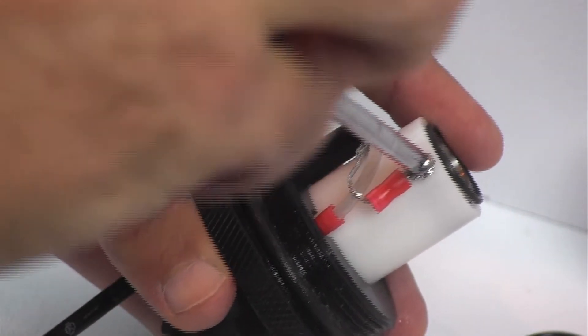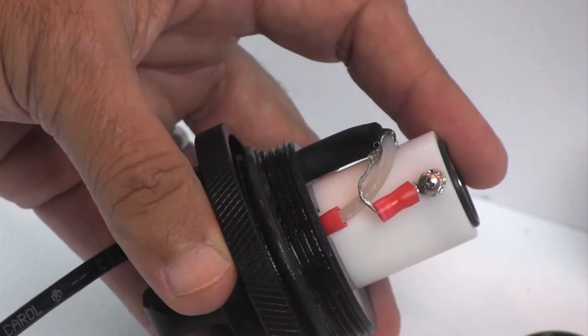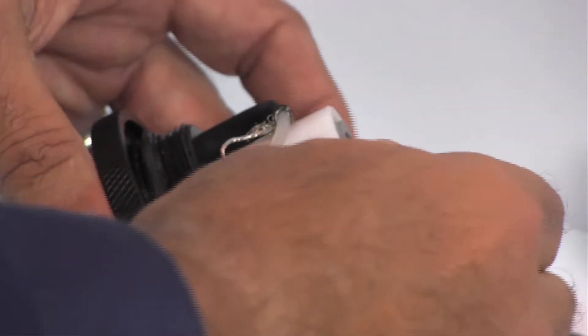Carefully remove the screws securing the electrodes to the probe sleeve. Take out the electrode along with the outer and inner O-ring seals.